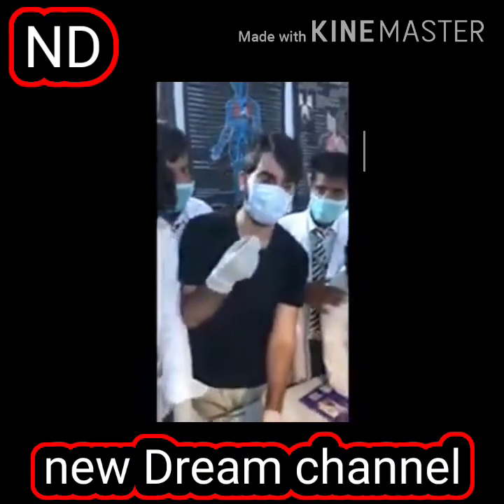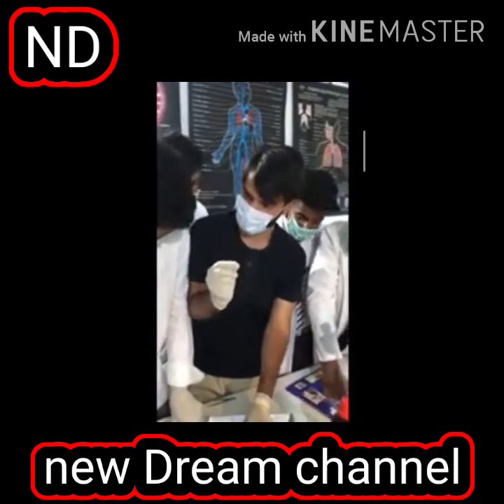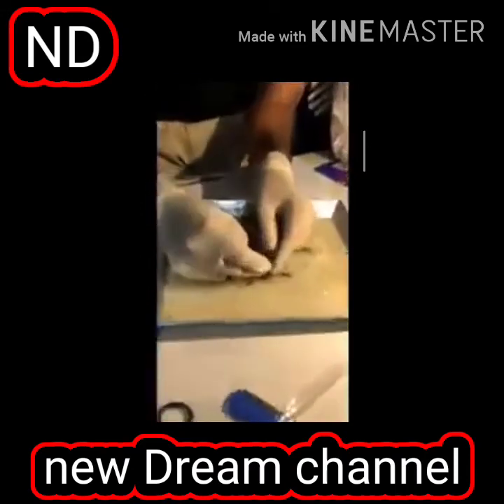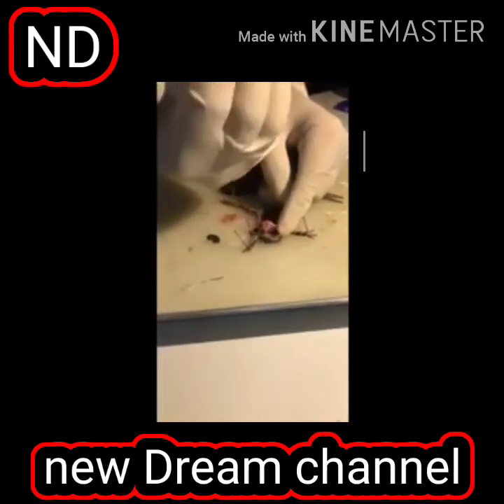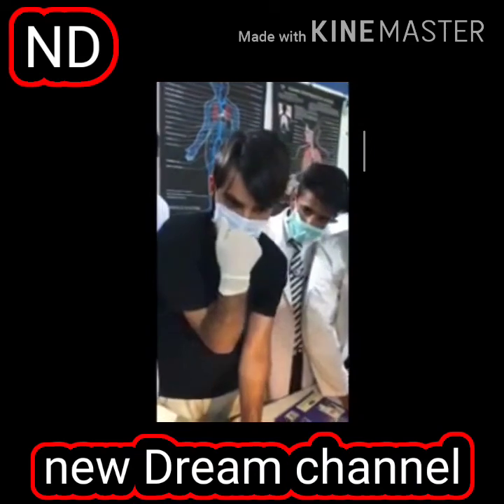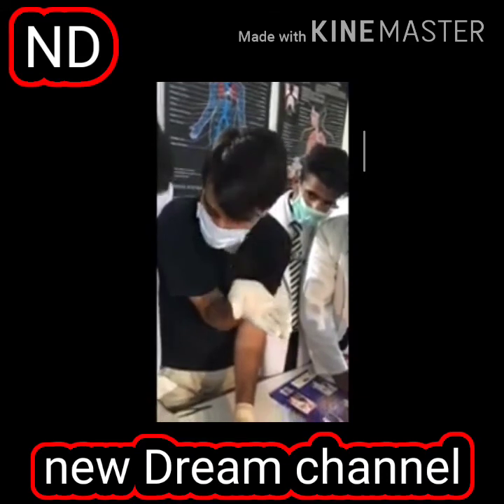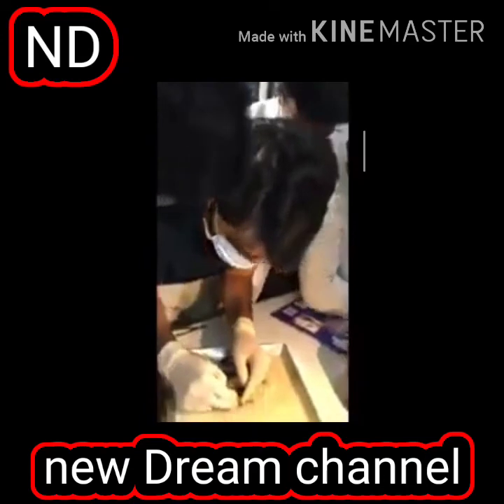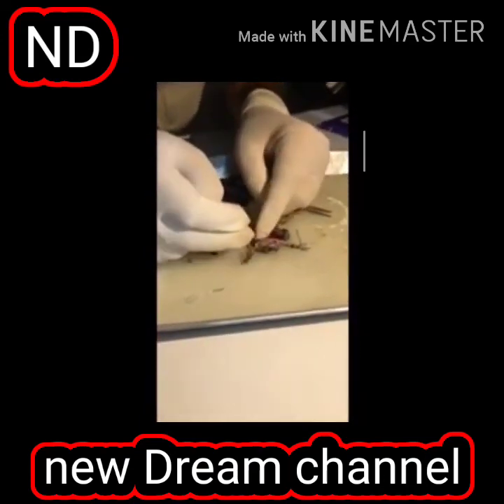The leg is intact on the posterior side, but the tongue is intact on the anterior side, on the frontal side. So when it wants to catch insects, it gets elongated. It throws it like this. The tongue will come out like this, and it will catch insects. Like in the chameleon, we have the tongue like this. It's intact on the front, and it is free on the posterior side.